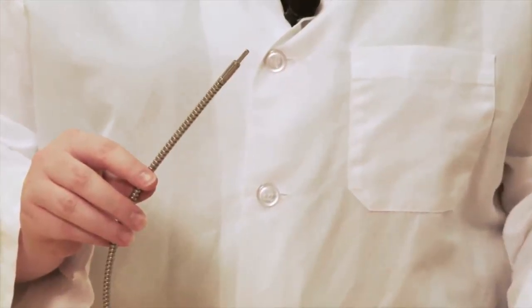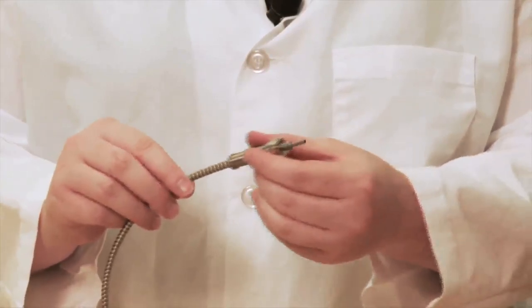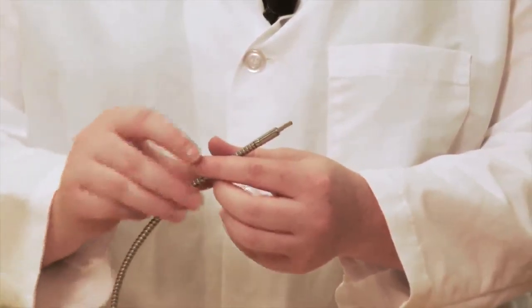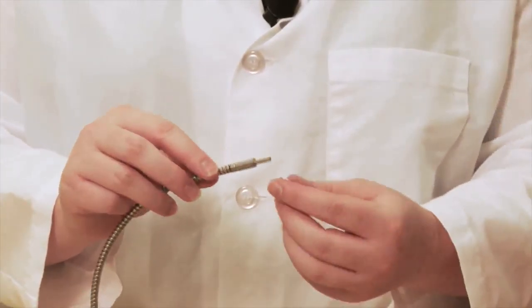Slide the metal strain relief sleeve onto the fiber optic cable. Slide the plastic sleeve onto the fiber optic cable.